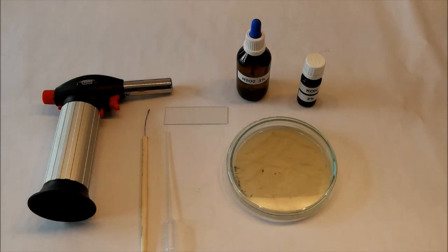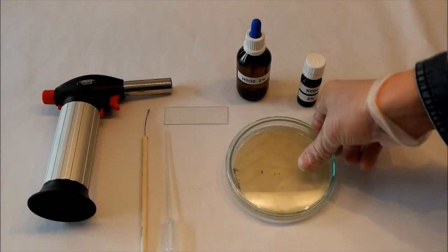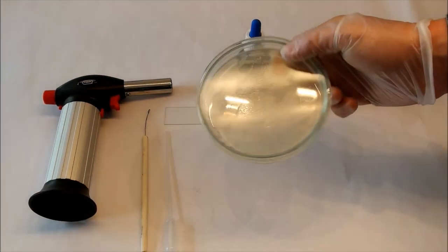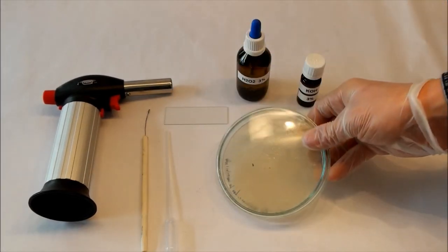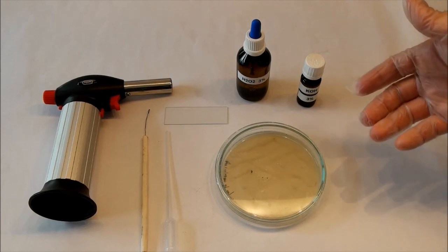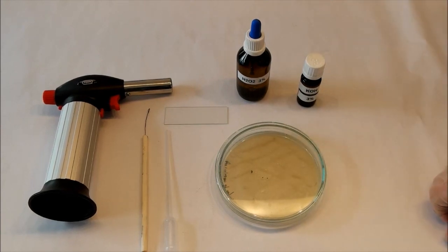Today I'll show you two methods to identify bacteria you have on your agar plate, like this one. So when I don't know what bacteria are there, there are two tests to find out what kind of bacteria you have got here.